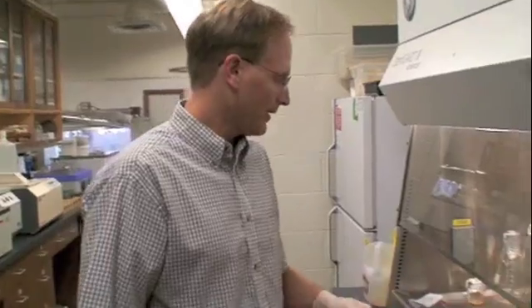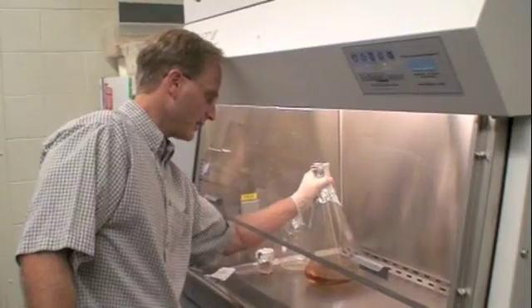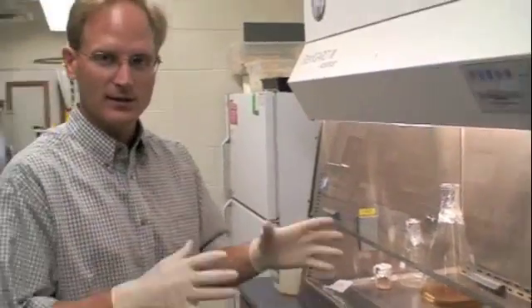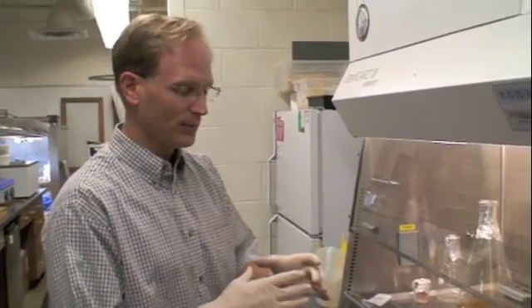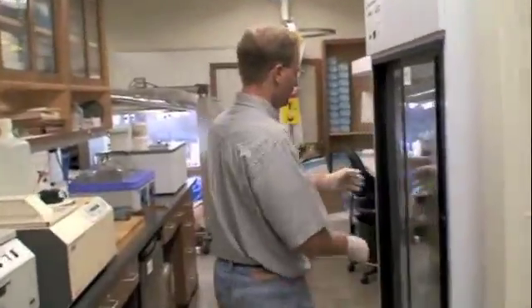Now, we have some media that does not have agar in it. We need to make some media that has agar in it, so that it'll form bacteria petri plates.